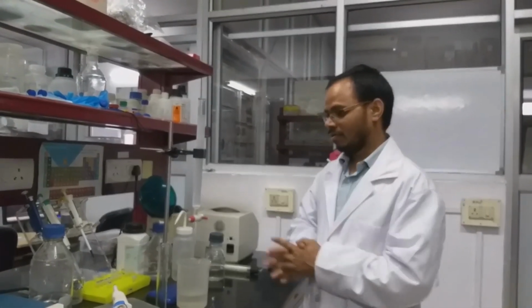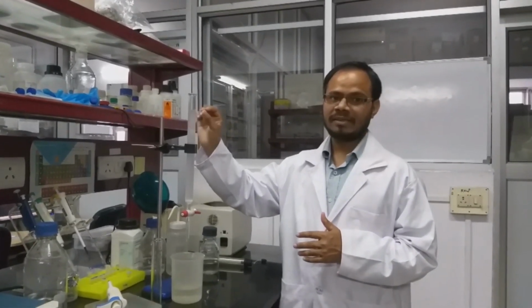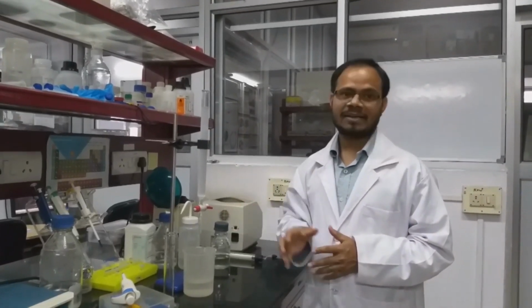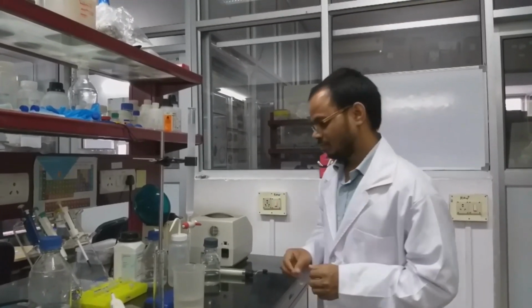For estimating the void volume, we can use blue dextran. First we cover the top with a piece of cotton, then we load the blue dextran. After sample loading, we start collecting the buffer until the blue dextran is completely eluted. That will give the void volume.